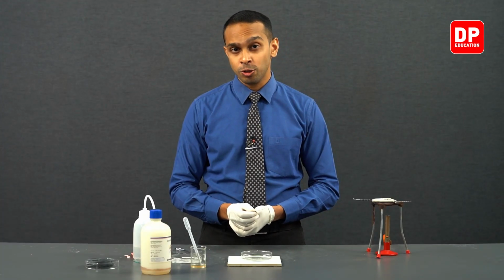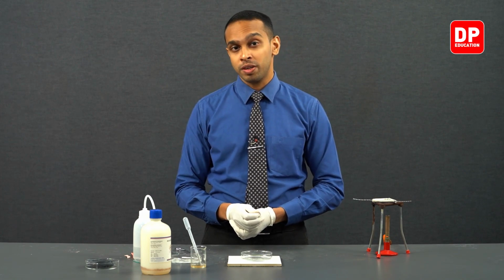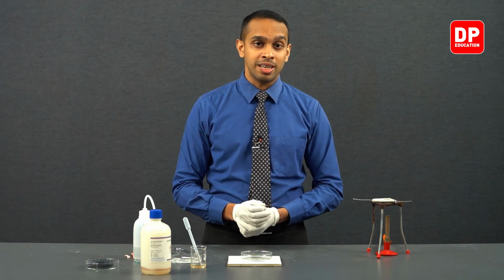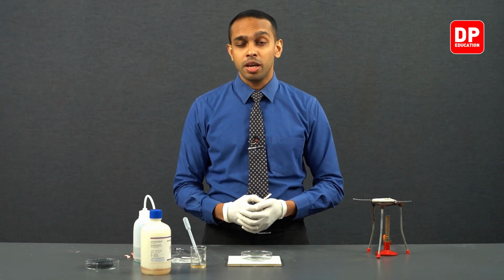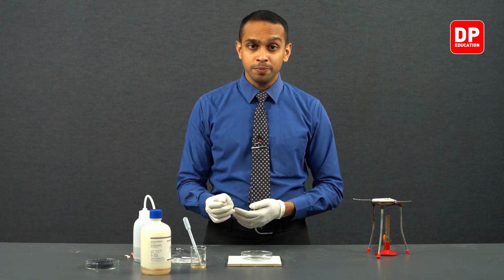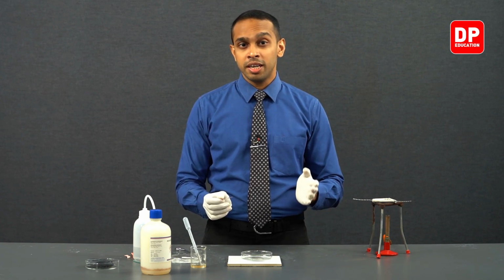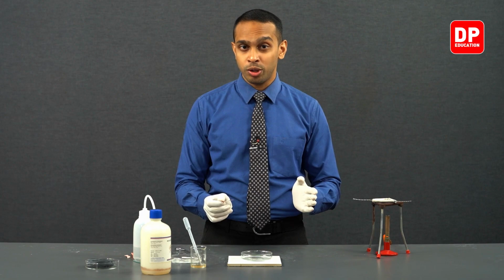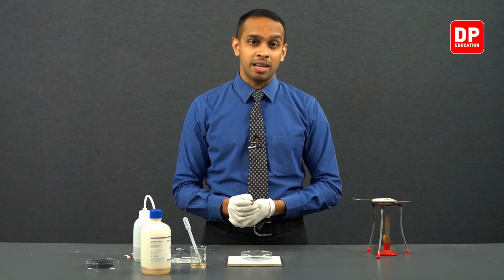As I mentioned earlier also, we have magnesium nitride and magnesium oxide. Of course, when you dissolve it in water, you're going to form magnesium hydroxide when magnesium oxide dissolves in water, but magnesium hydroxide is not very soluble in water. However, magnesium nitride, when it reacts with water, it will form ammonia, which will make the solution alkaline.